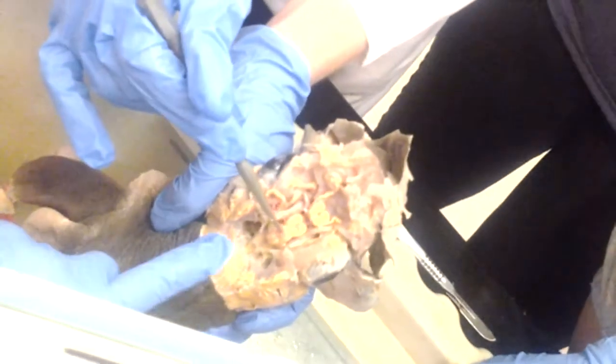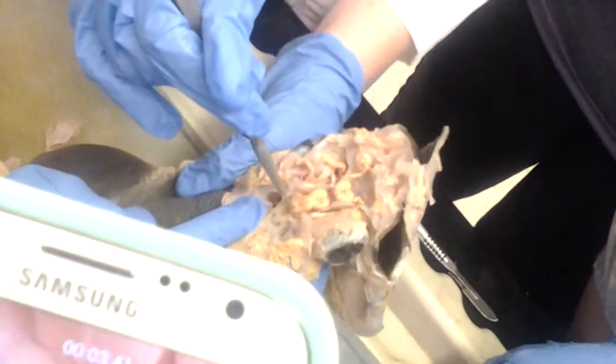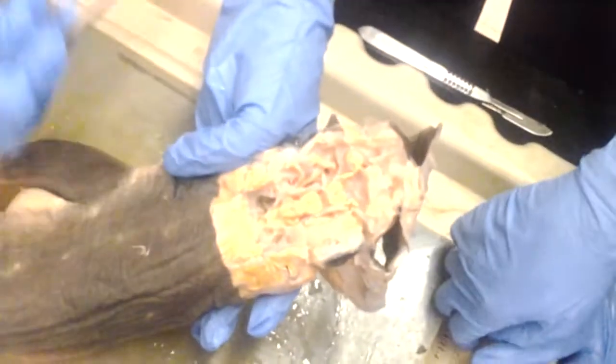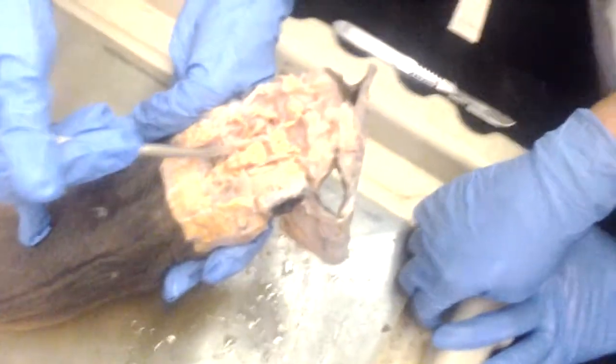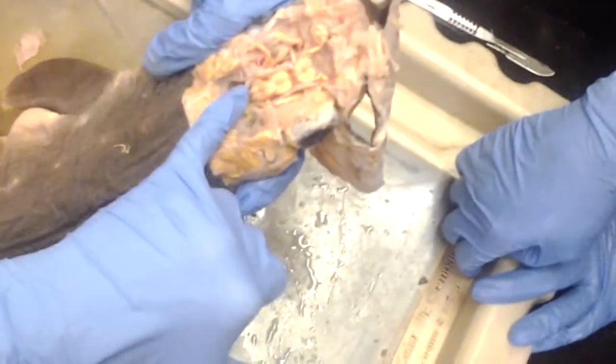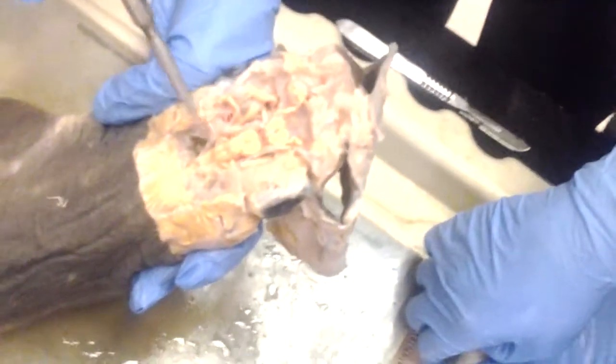Cerebellum. And what are the two lobes, the back lobes? These are the auricles. On either side of the cerebellum are the auricles. This is one auricle, this is the other auricle. Auricle, is that the ear? No, not ears. They're called auricles because they look like little ears, but they're part of the medulla. And then what about these two back lobes? Was that part of the cerebellum? This whole big round thing is the cerebellum, yeah.